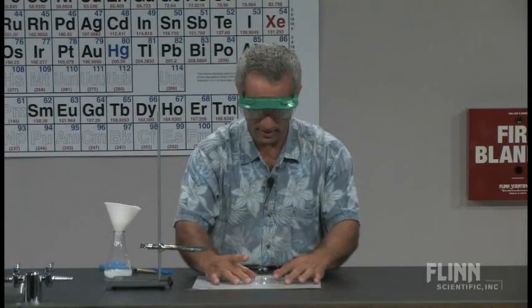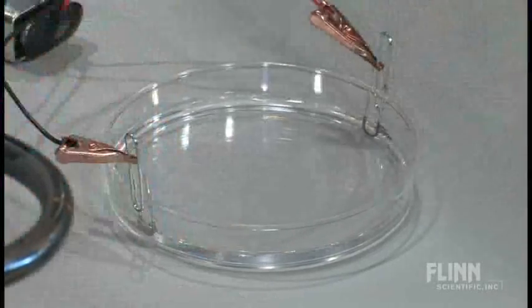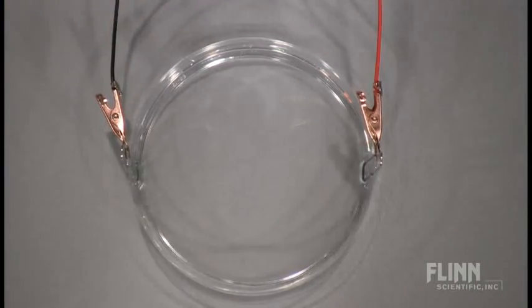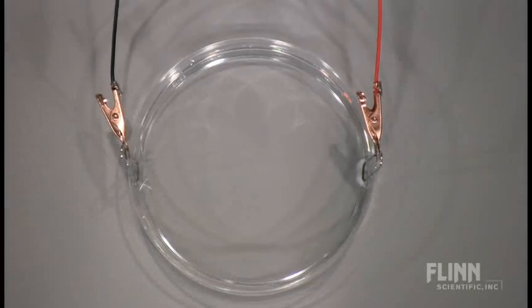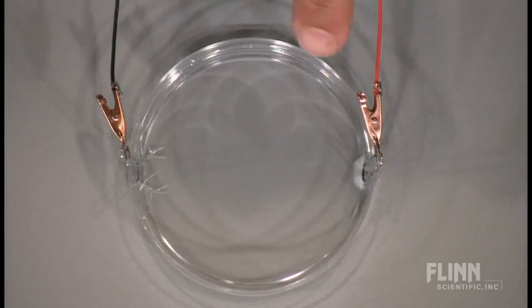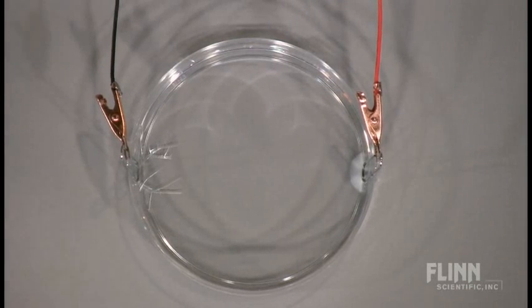I think I don't have enough, but I do — I'm just going to tip it like that. And now I'm going to connect these two electrodes to the two sides. And right away, the camera can focus on this electrode over here — we've got nice little crystals of tin forming. They're gorgeous. Looking straight down, they're already about a quarter of the way across the Petri dish. On the other side, we have an interesting thing going on. You might be thinking tin-2 forming tin on one side, and chloride forming chlorine on the other — but the other side does not have chlorine bubbles.